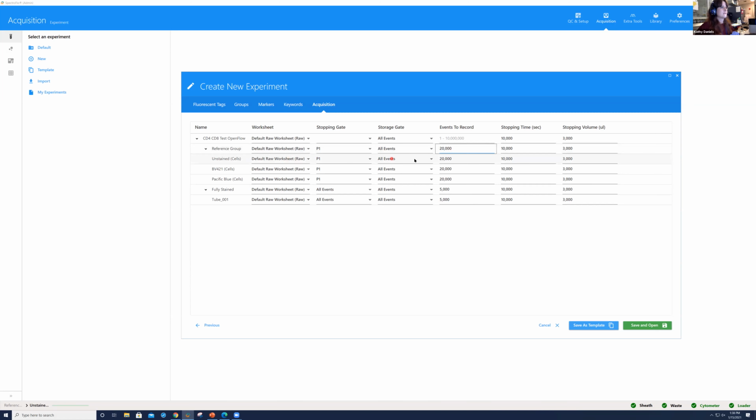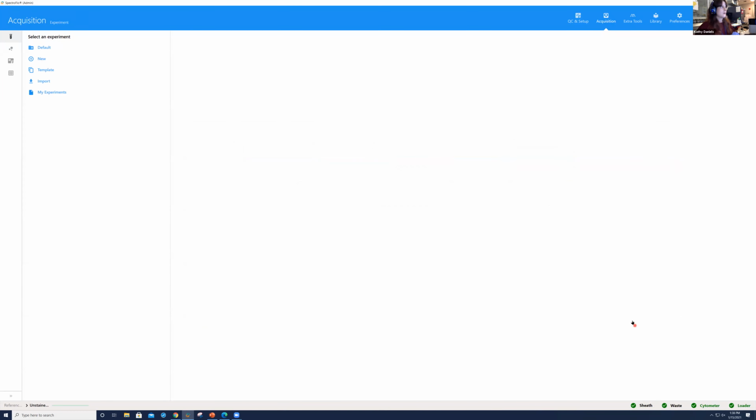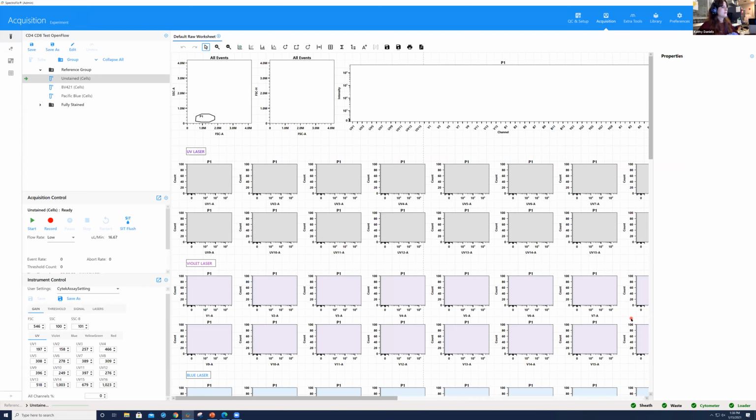Typically for unstained, I like to make sure that I record at least 20 or 30,000 or so. I'm not going to put anything in for time or volume. I have a good volume in my tubes and it should go pretty quickly, but that is something you can adjust if you wanted to. At this point, I'm going to save and open this experiment, and it's going to automatically open up this default raw worksheet for us.